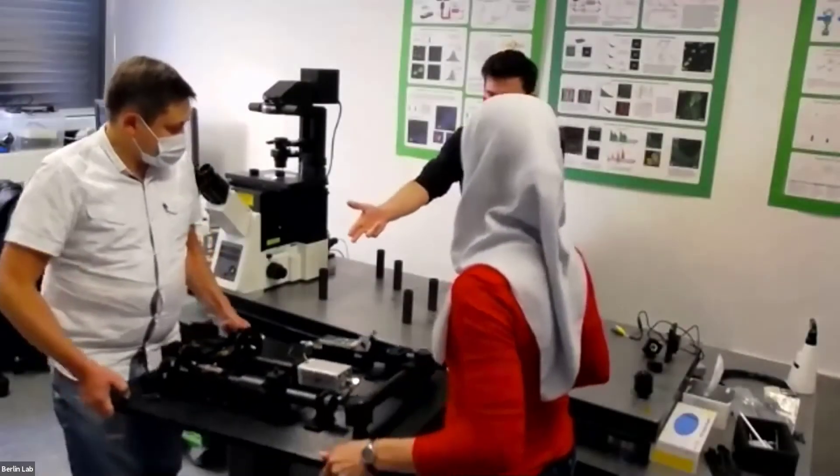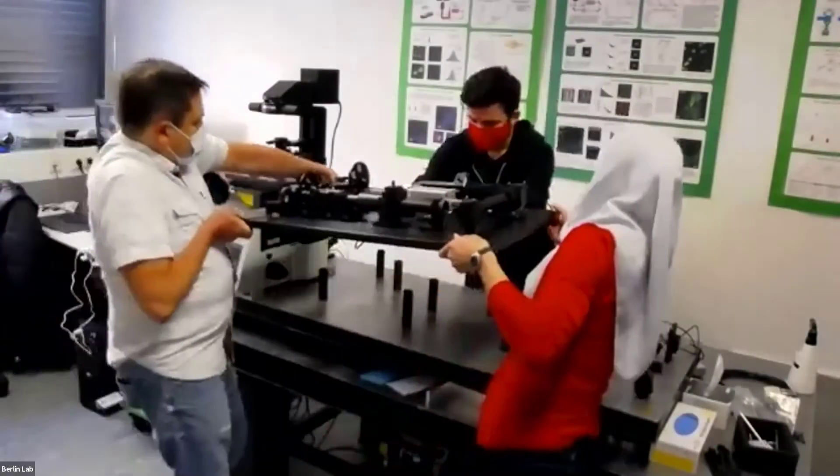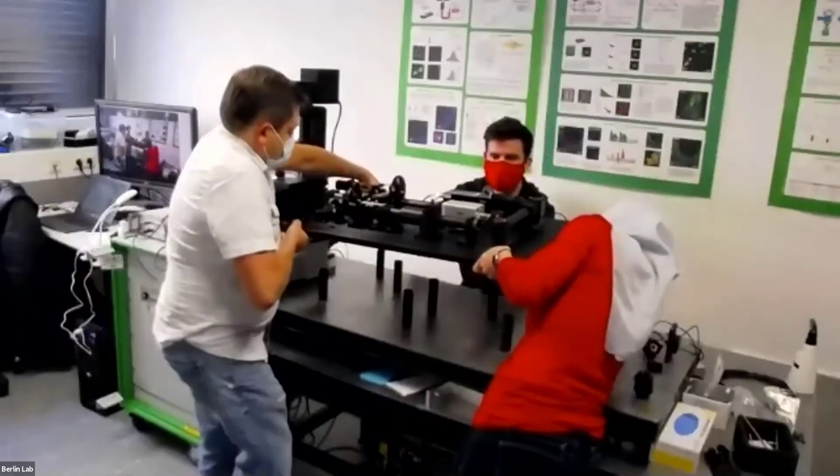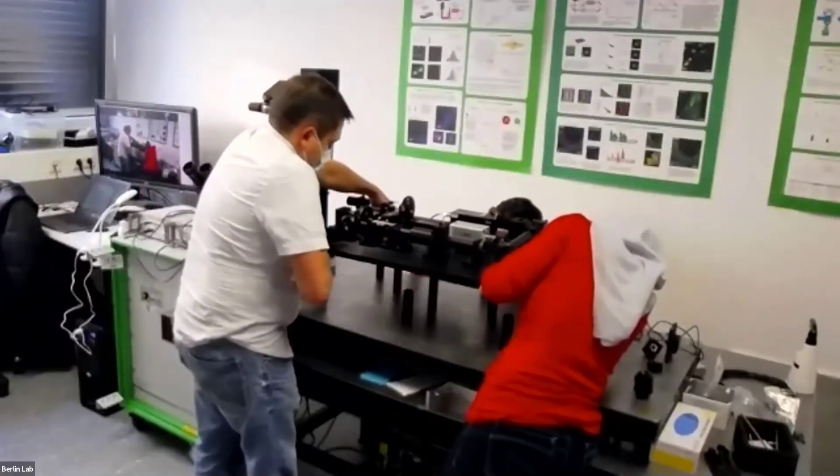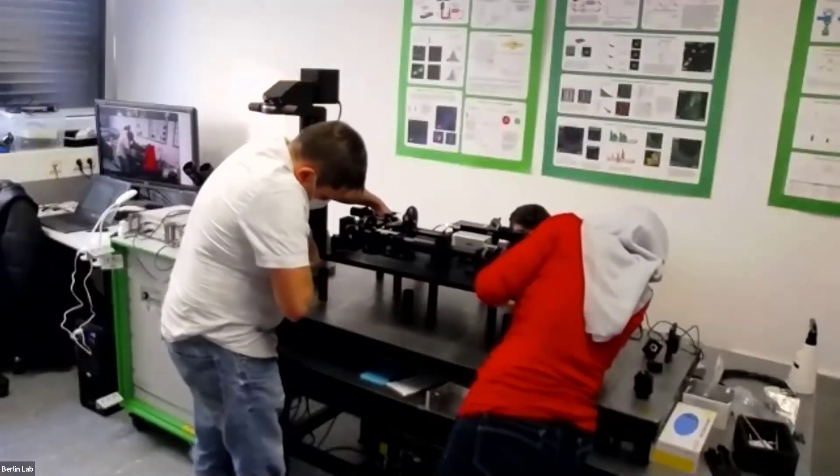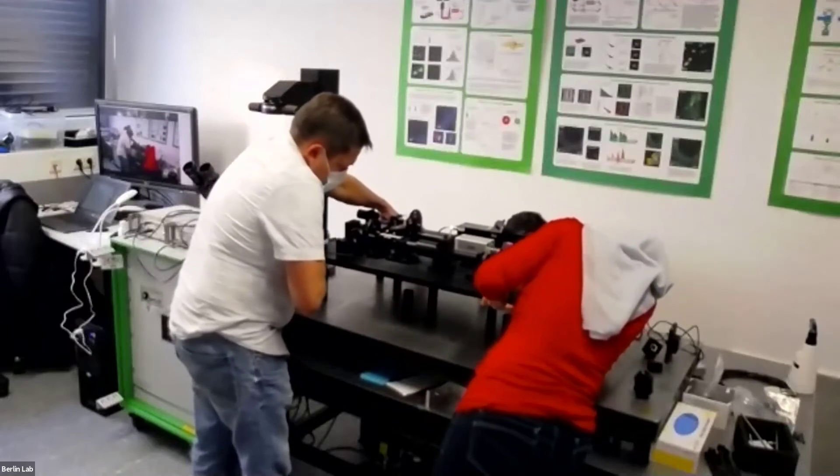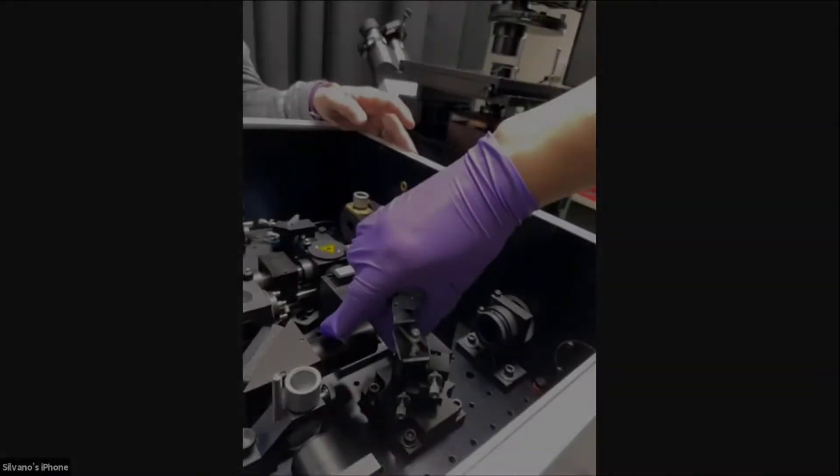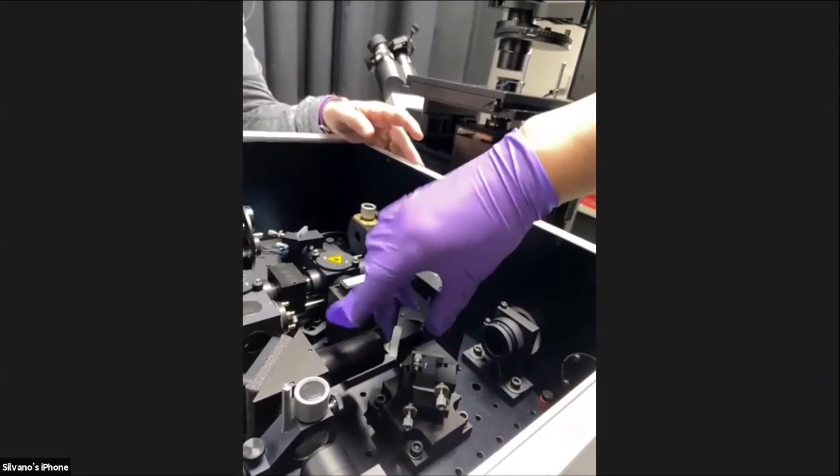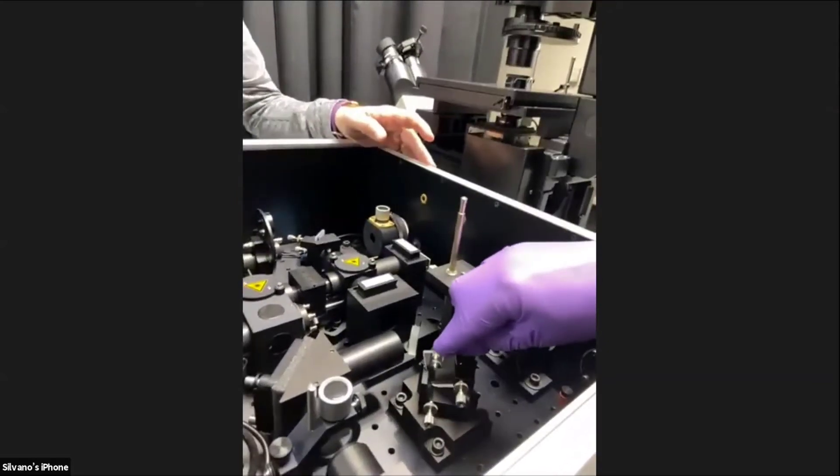Okay, now they're lifting up, so then back, and then I'm scrounging down here behind, and a little bit more back, and down. Good, just drop it. Yeah, good, perfect, and then down.